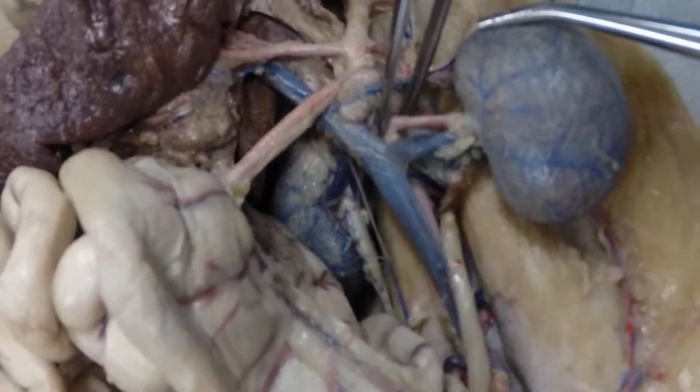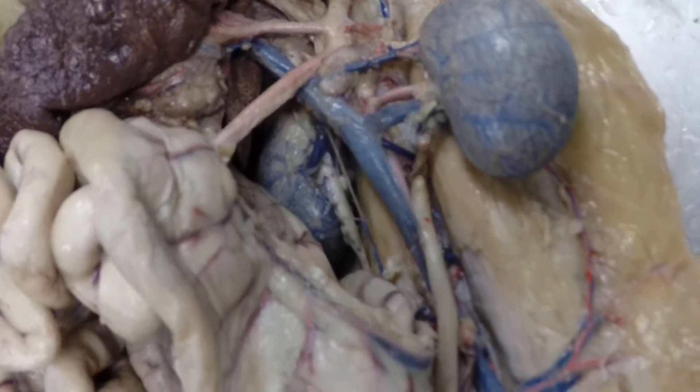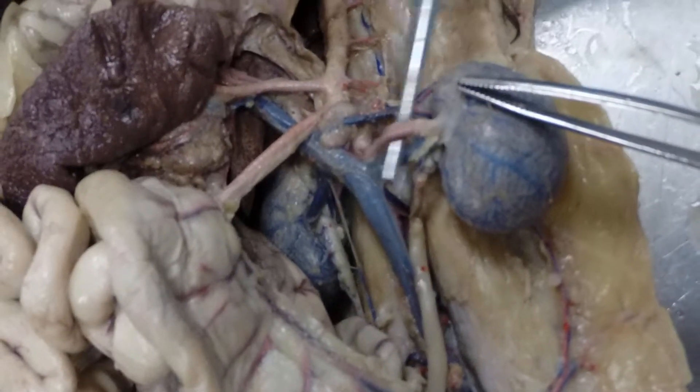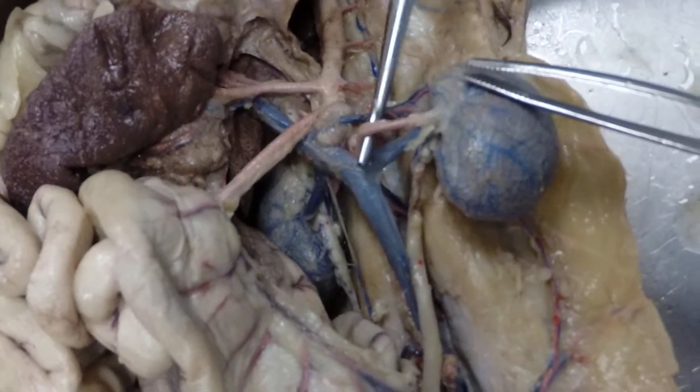Back on the descending abdominal aorta, our next branch is the renal artery — this would be a left renal artery.